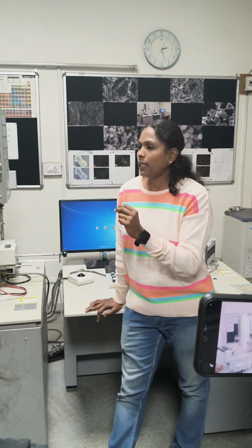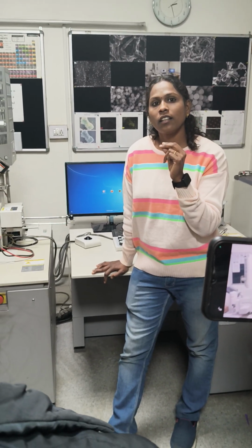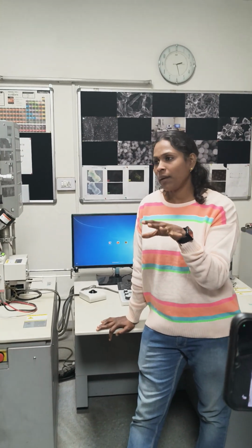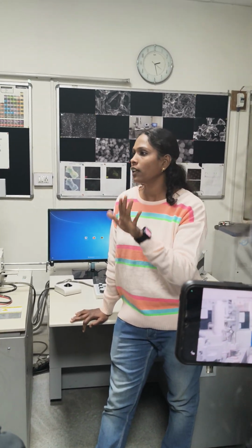So if your sample is, which department do you all belong to? Chemistry? Pharmacy. Zoology, biological, right? Mostly biological? Nanoscience? Now material science also. Okay.